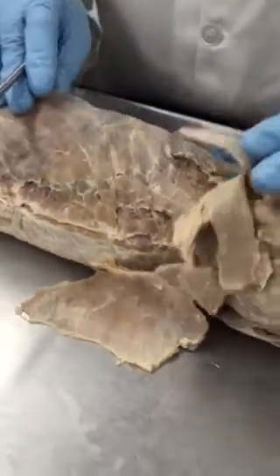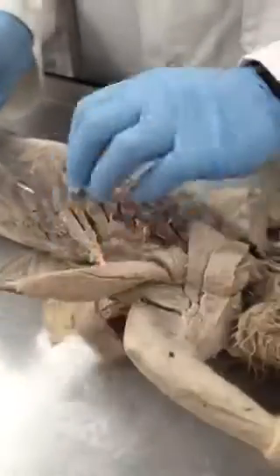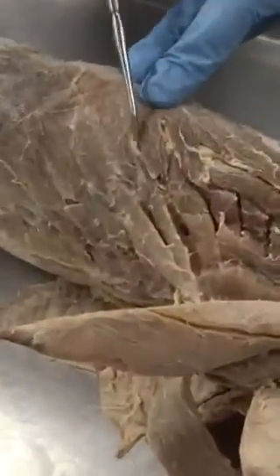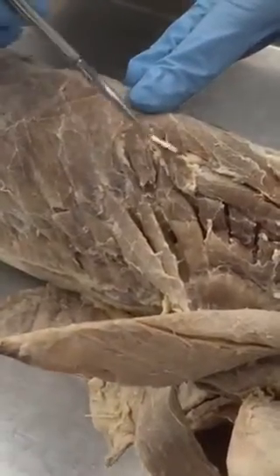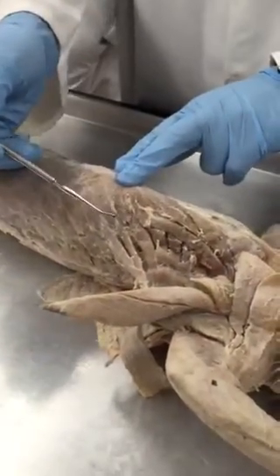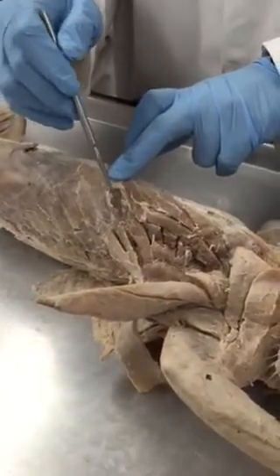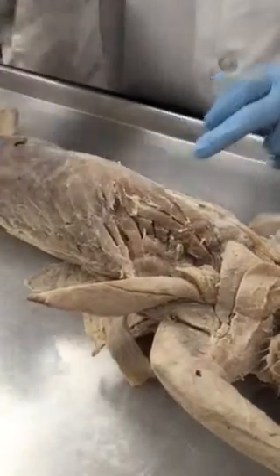All right. Coming back towards the ventral side, you have the serratus ventralis here, and the other muscles that go towards them on the rib region, these are intercostalis externus. You cut and reflect the intercostalis externus, and you find intercostalis internus here.